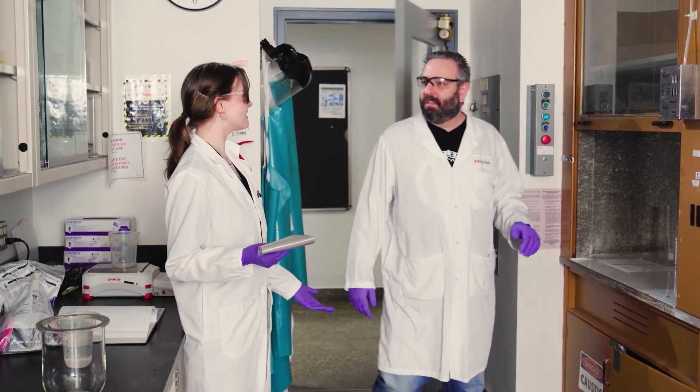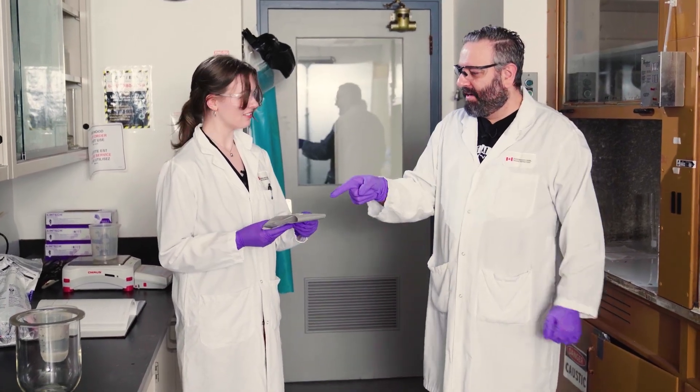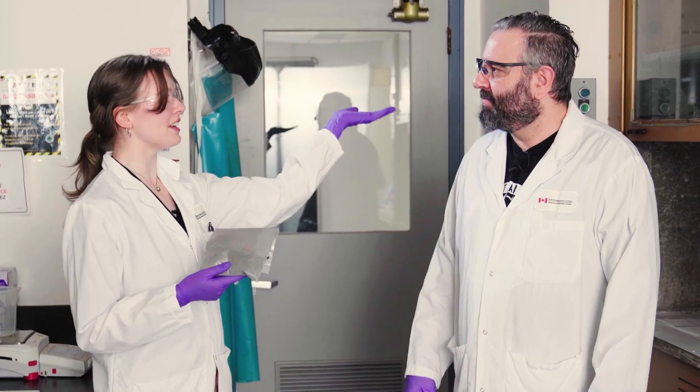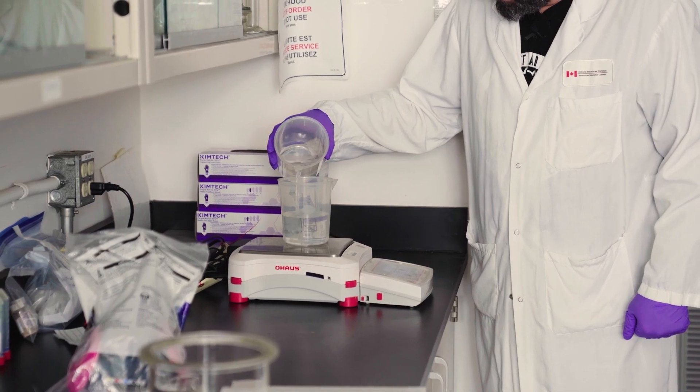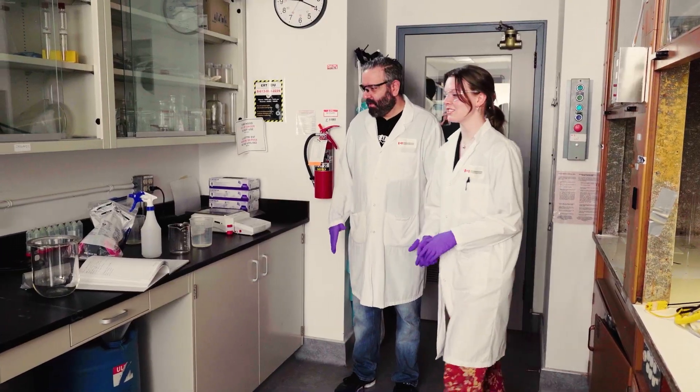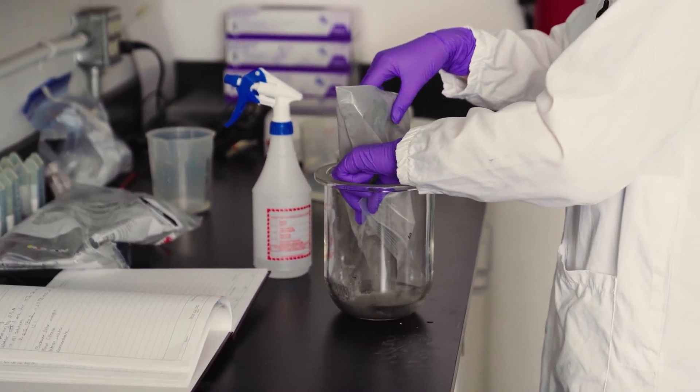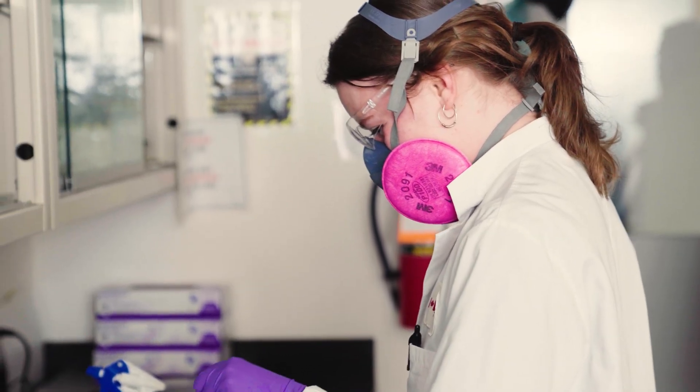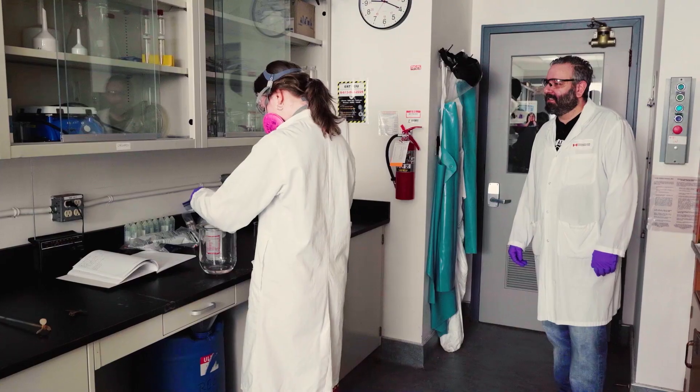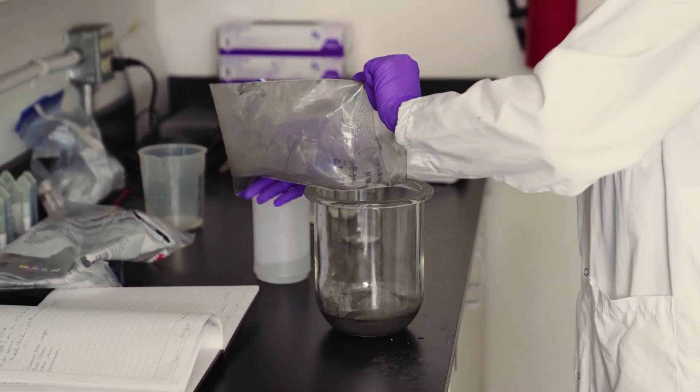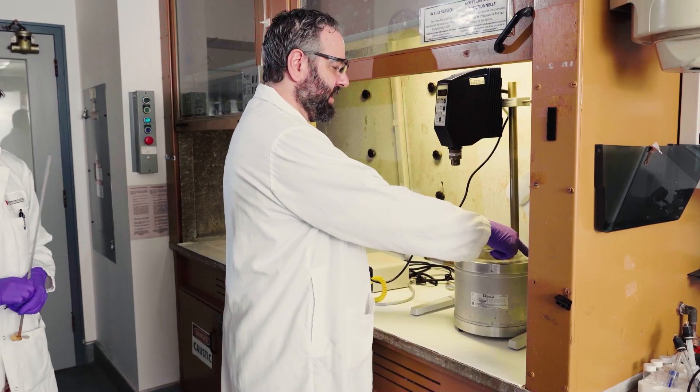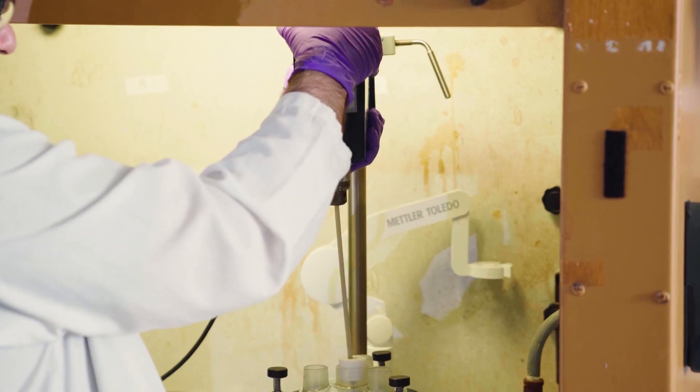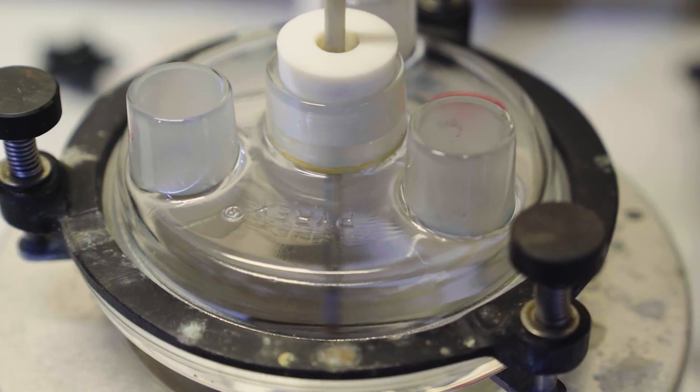Okay. Now we're going to do some acid leaching. Awesome. I'm going to do some acid leaching. Okay. Yeah. What do you have there? I've got this concentrate that we literally just made in the other room. Yes. So let's start by measuring out some water. We need 580.2 milliliters or grams to make 25% solids. So the next thing we're going to do is put our stuff together in the reaction vessel. You sound a little bit like Bane from Nolan's Batman. That's what I was going for. Are you ready for the big responsibilities now? Grab our reaction vessel. So I put it in here. Here. Then this goes here.